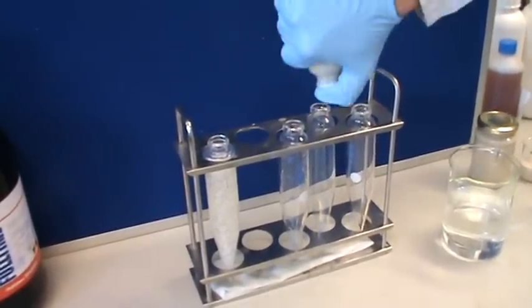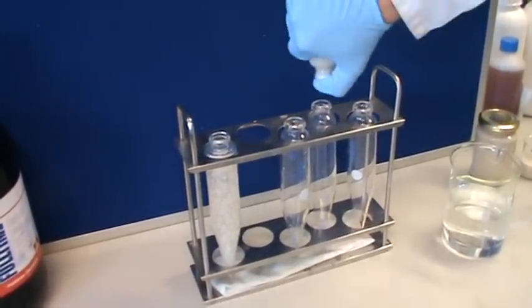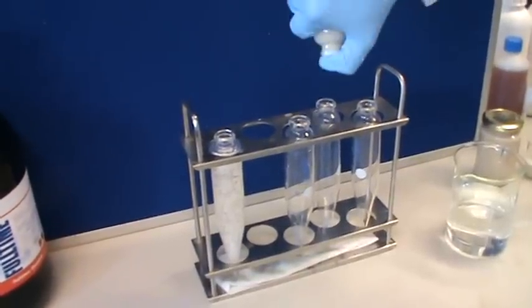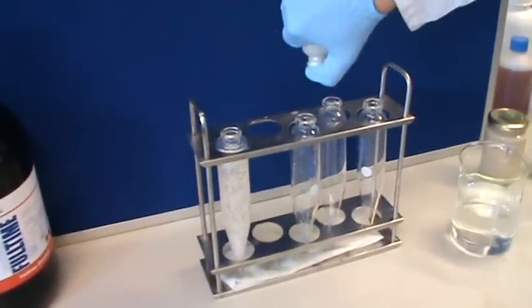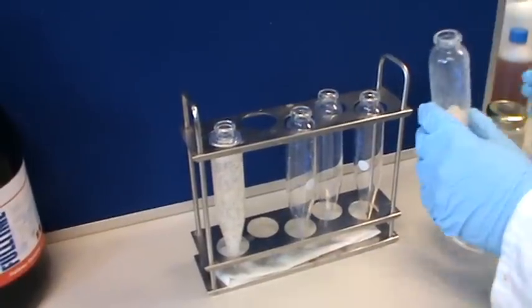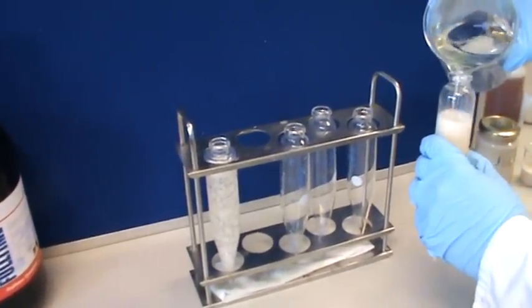Obviously the SC needs to be mixed in more efficiently. And then we top up again with water. That again is just remaining to fill your spray tank.